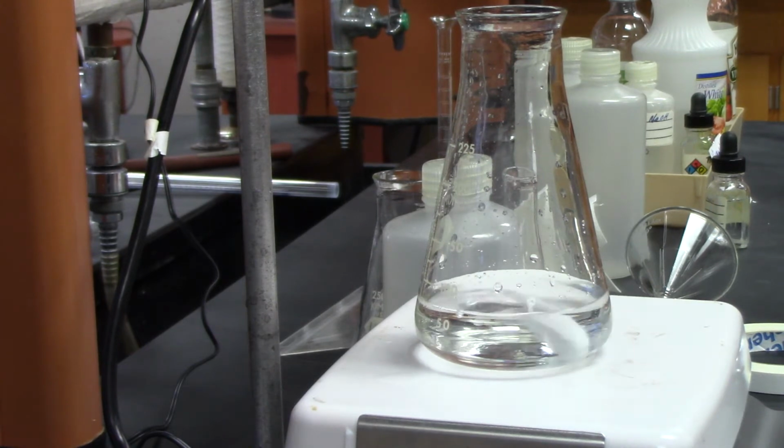See, what happens is it looks like nothing's happening. It's going real slow, and then all of a sudden it'll turn pink. So you just got to be careful. And actually, the slower the better because you want to be accurate. But typically, I try to go a little faster than this. Next time, I'll go a bit faster because I'll clean this out and make sure it gets a good flow.